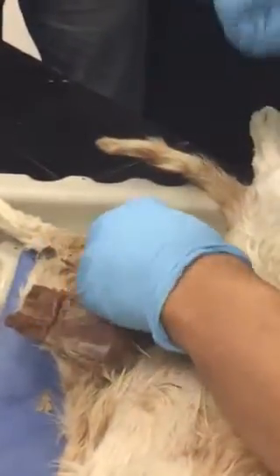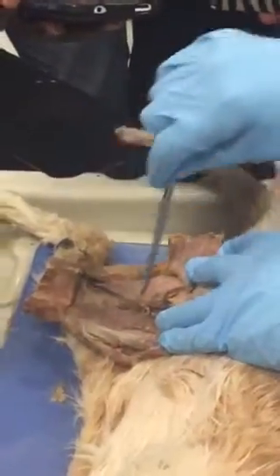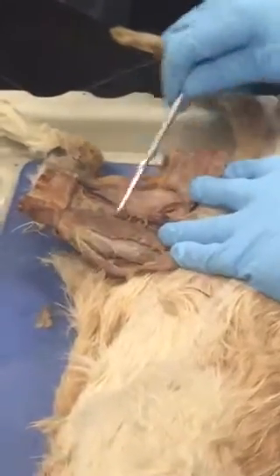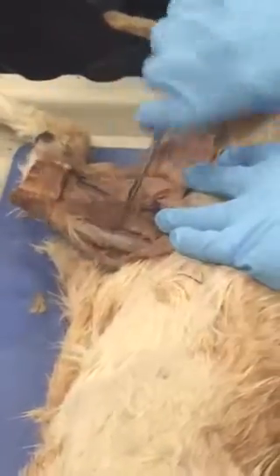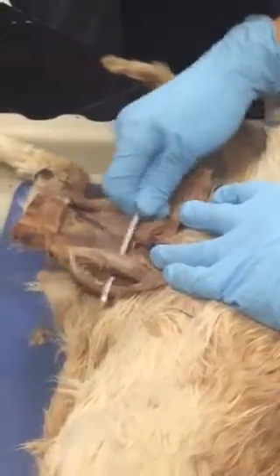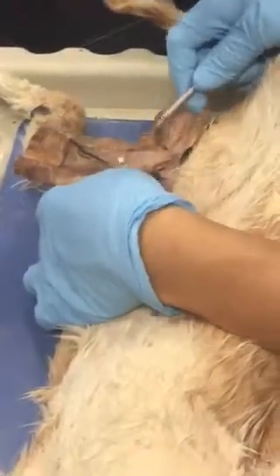Once you remove those two on the model, let's first look at the anterior group. This is anterior, this is posterior, regardless of what they are. In the anterior group, you have this muscle. Right now, don't worry about what it is. And then you have this muscle. This muscle, you know that familiar sound when you chew on something, if you're not a vegetarian. Sorry. And then this one. Does it make sense?